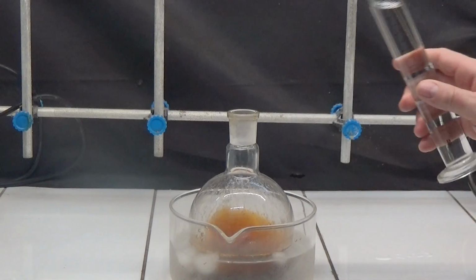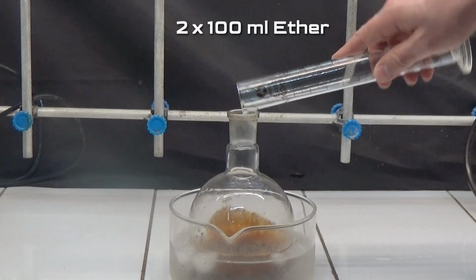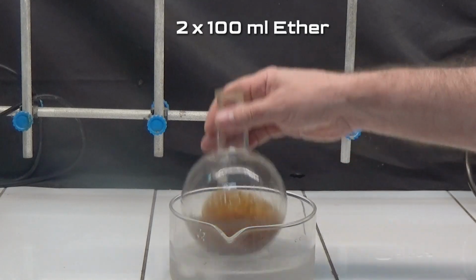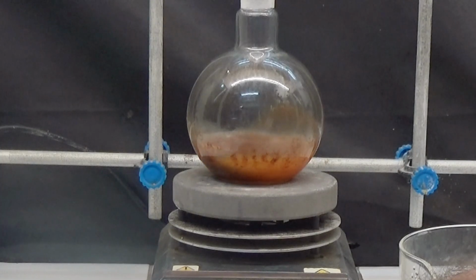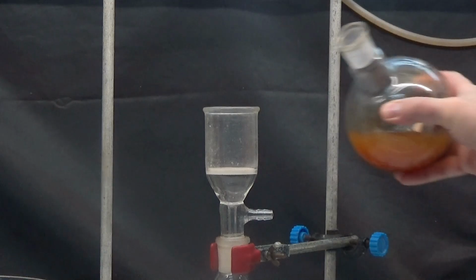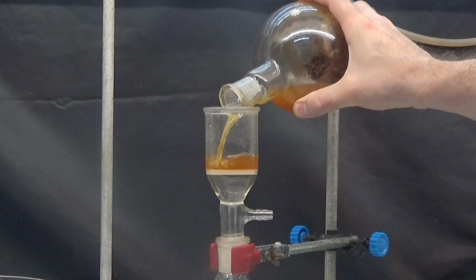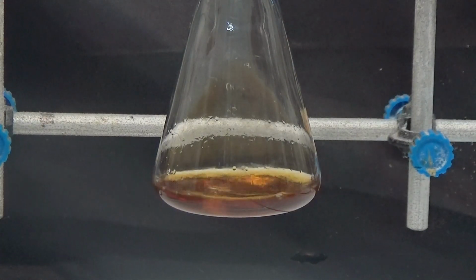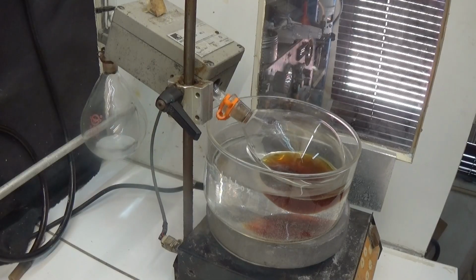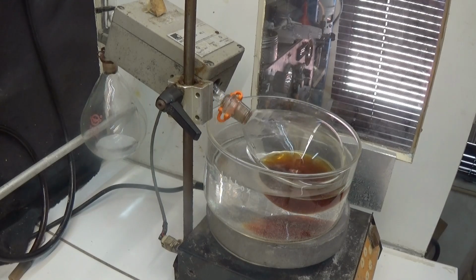Extract the content with 100 ml of ether. A brown residue is observed that is difficult to dissolve in ether. Shake to dilute most of the product. Filter through a funnel without suction and repeat the extraction operation 2 more times. After evaporation of all the ether, a reddish-colored liquid was obtained.